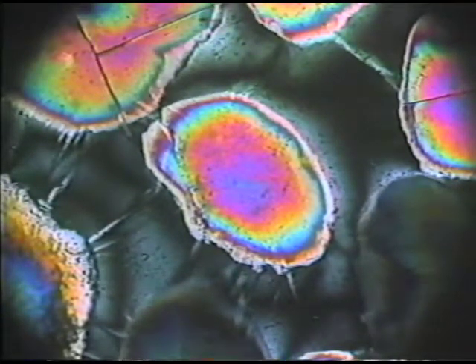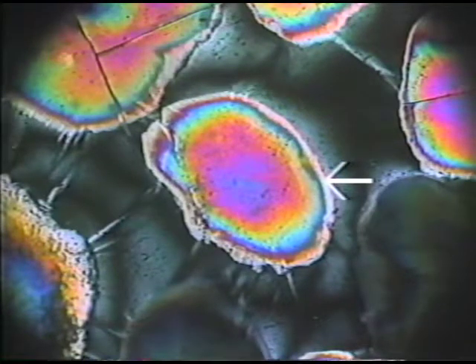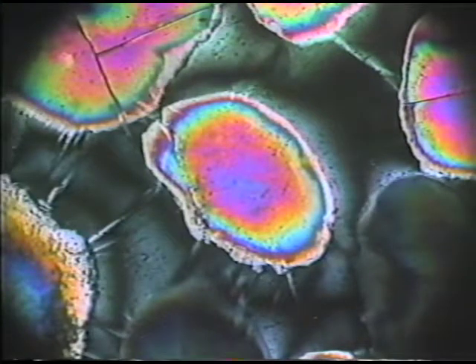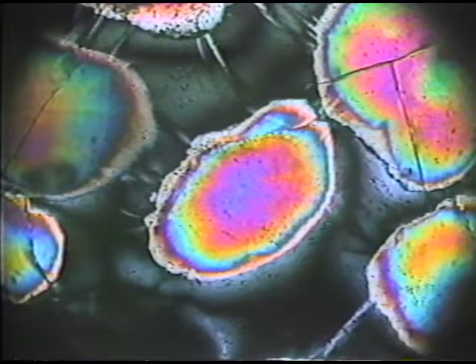I can point out to you that the sequence of interference colors that occur from the edge of the grain to the center of the grain is the same sequence that you see on the Michel-Levy chart. Here, for example, is our first order white color, and now we're going into the second order and finally some third order colors in the center of these quartz grains. So that this particular grain then does not show one interference color, but instead shows a whole sequence of interference colors from the center to the outward edge.